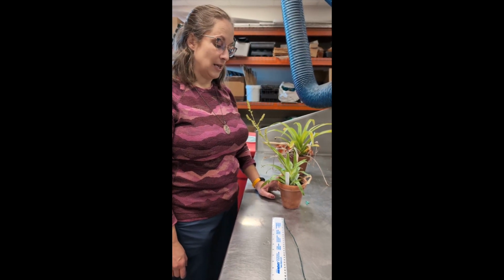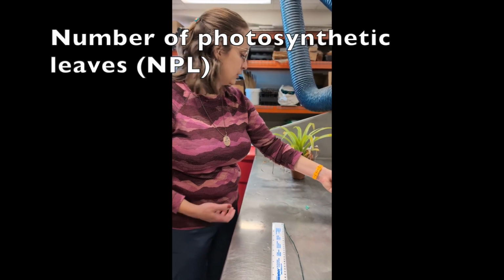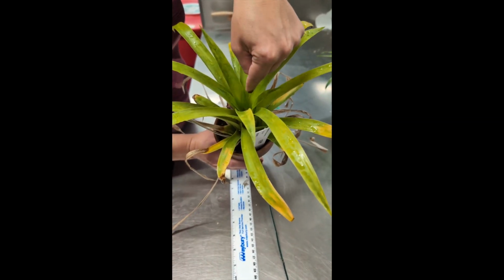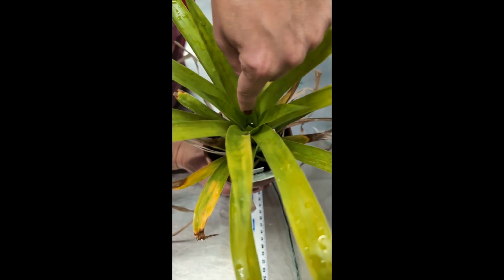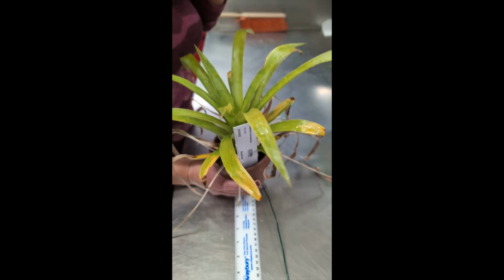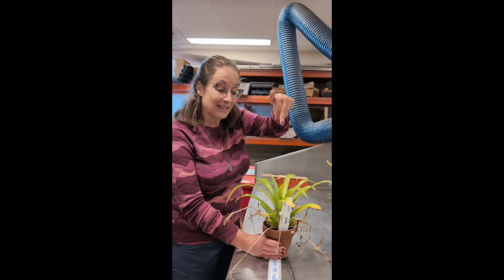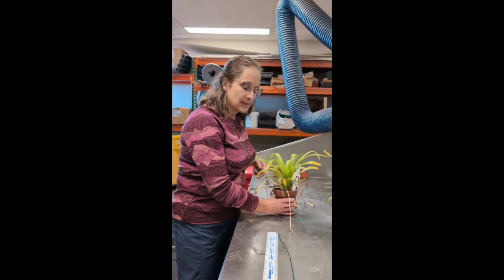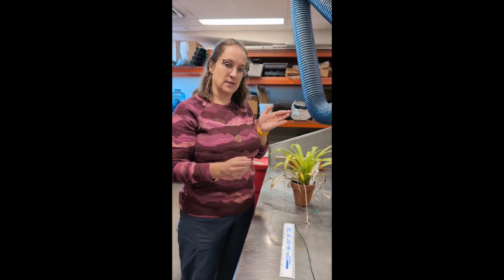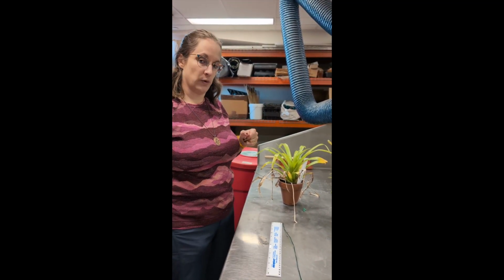Then the next metric we take is the number of green or chlorophyllous leaves. That can be really tricky on a rosette plant because of how they spiral down, down, down. It's really hard to count how many total little leaves there are without tearing the whole thing apart, and there are so many little ones deep down in there. So we decided we needed a place to stop counting the earliest or youngest leaves, the same stop point across individuals and across researchers.